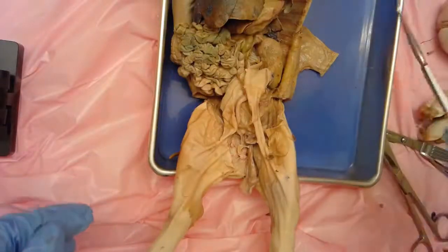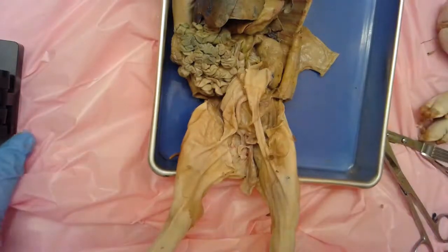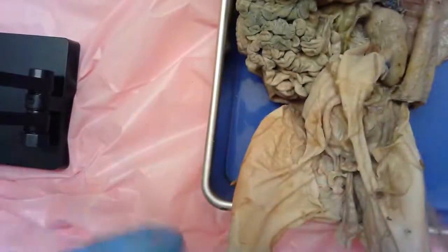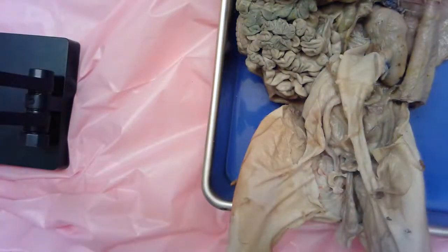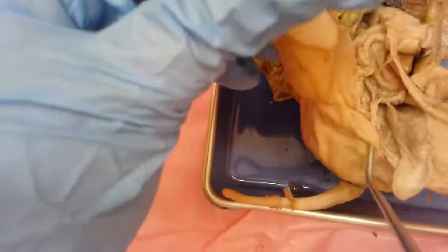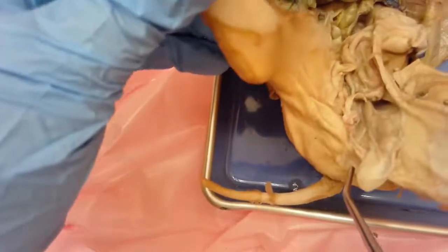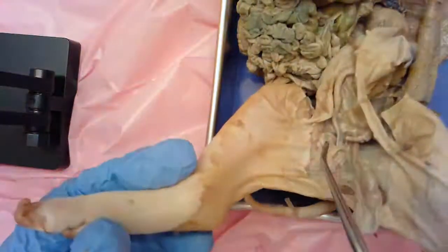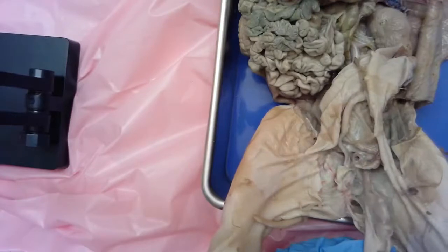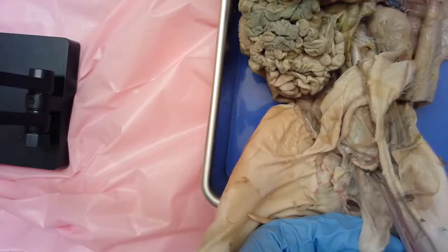We are talking about the reproductive system in the male, and we're going to zoom in and point out some external structures. I've already done some of the dissections, so things look a little different than they would have in the beginning. Remember that little bulge at the rear where the testes are located - I've cut that area open, and this is one of the scrotal sacs. You can see the outside skin covering the testes and the spermatic cord.